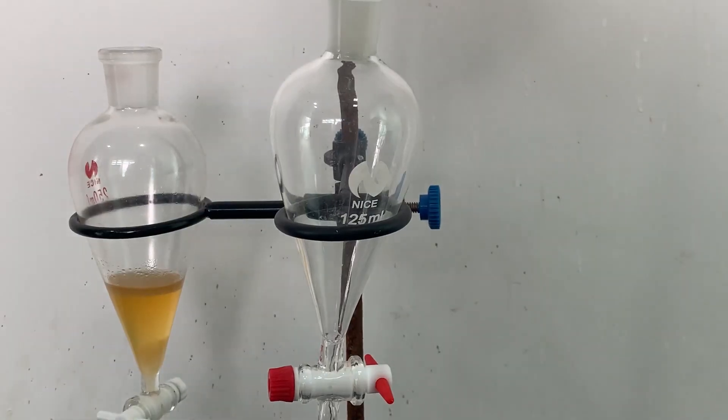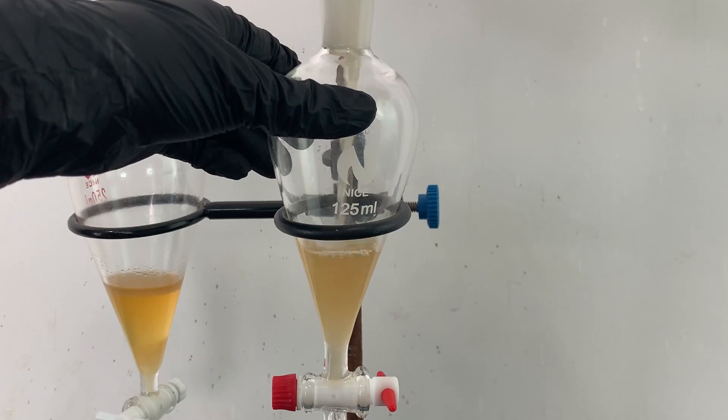I then filtered the crude cyclopentanone and transferred it into a separatory funnel.